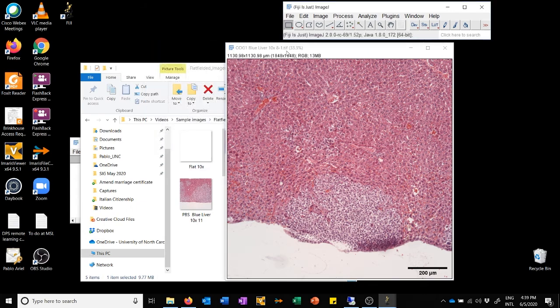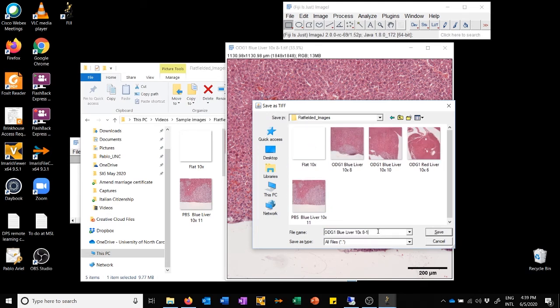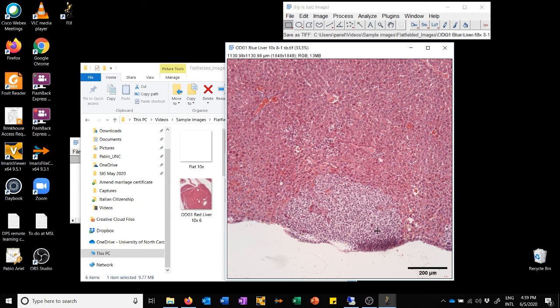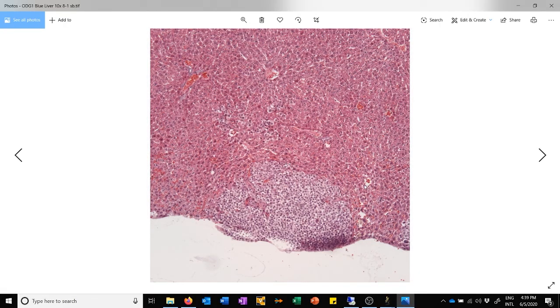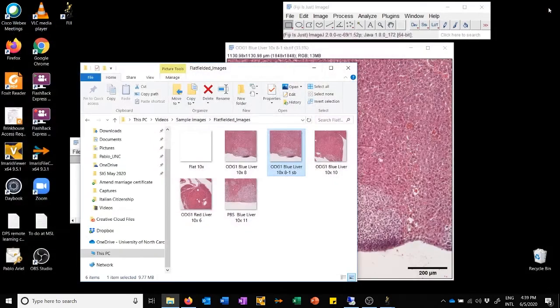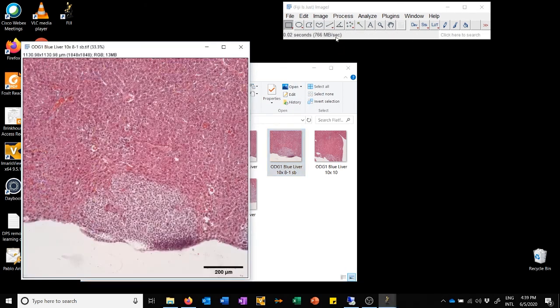And so then if you save this image, and you can save it in flat field. And I tend to add an SB or something indicating that this image had a scale bar, in case I change my mind later. If we now go and double click on that image, okay, so this is good. This is a problem that occasionally occurs depending on where you open the image. You can see that even though this is the scale bar image, it doesn't have a scale bar. However, if I drag this image into Fiji, it does have a scale bar.